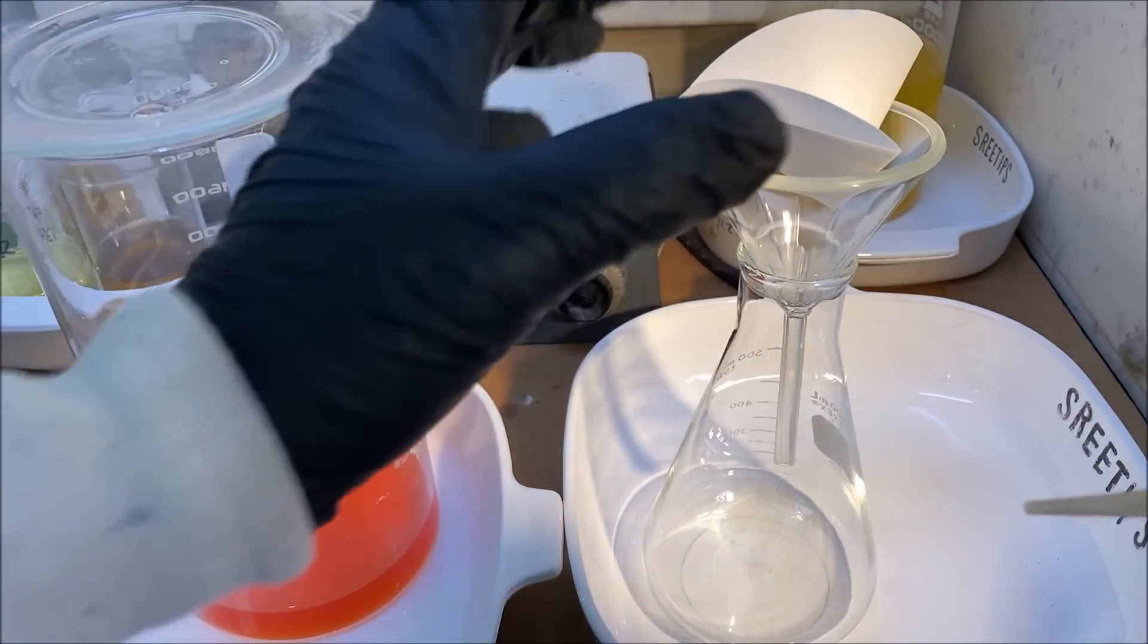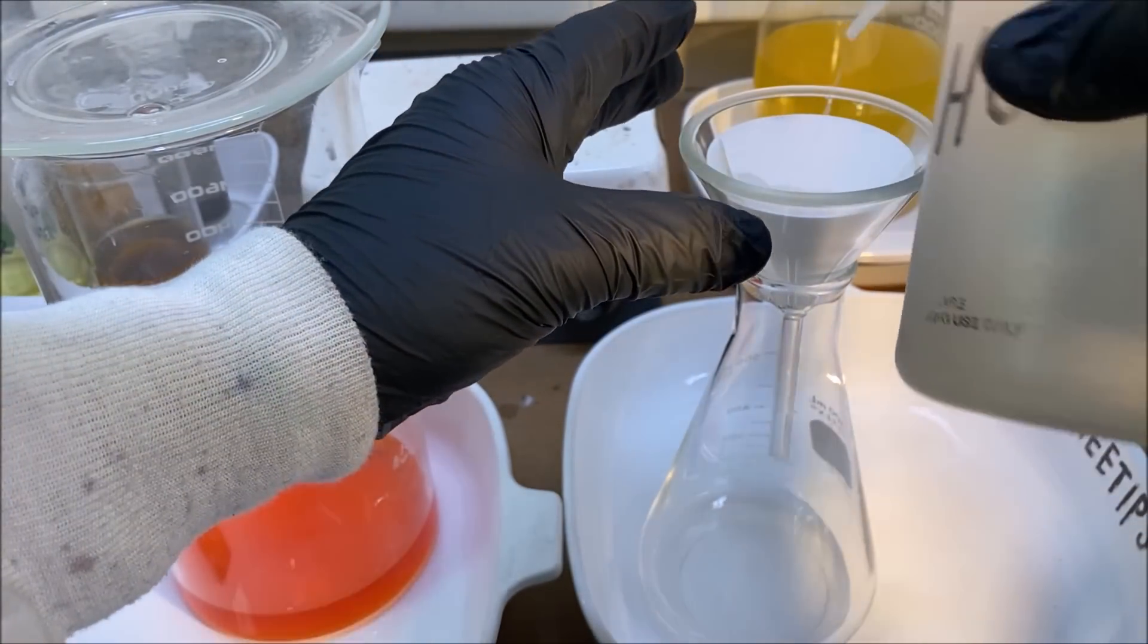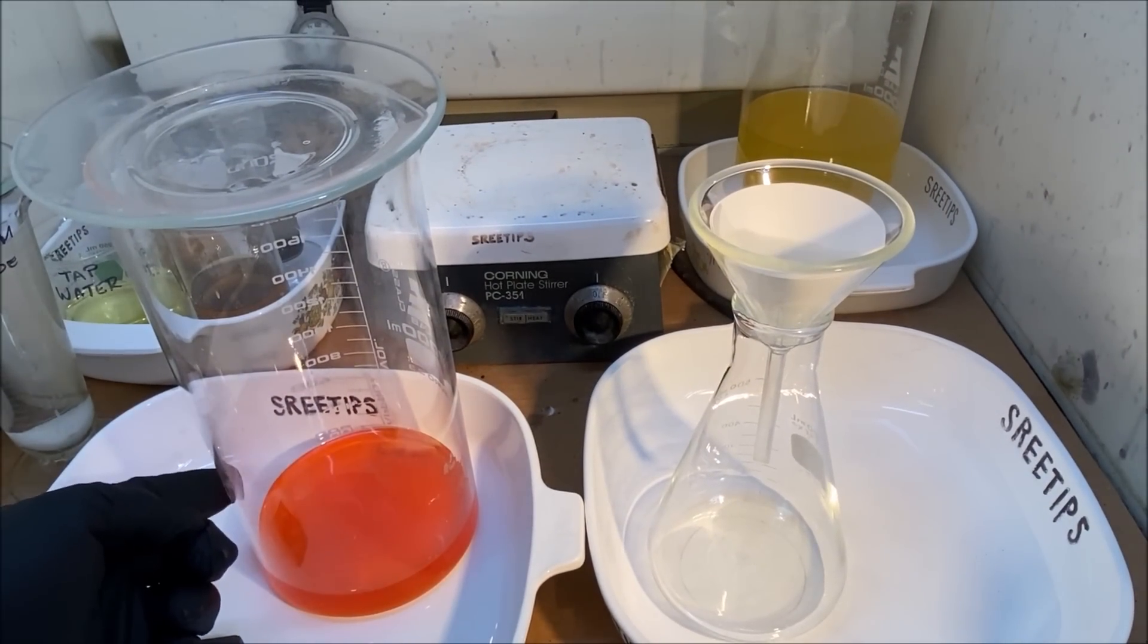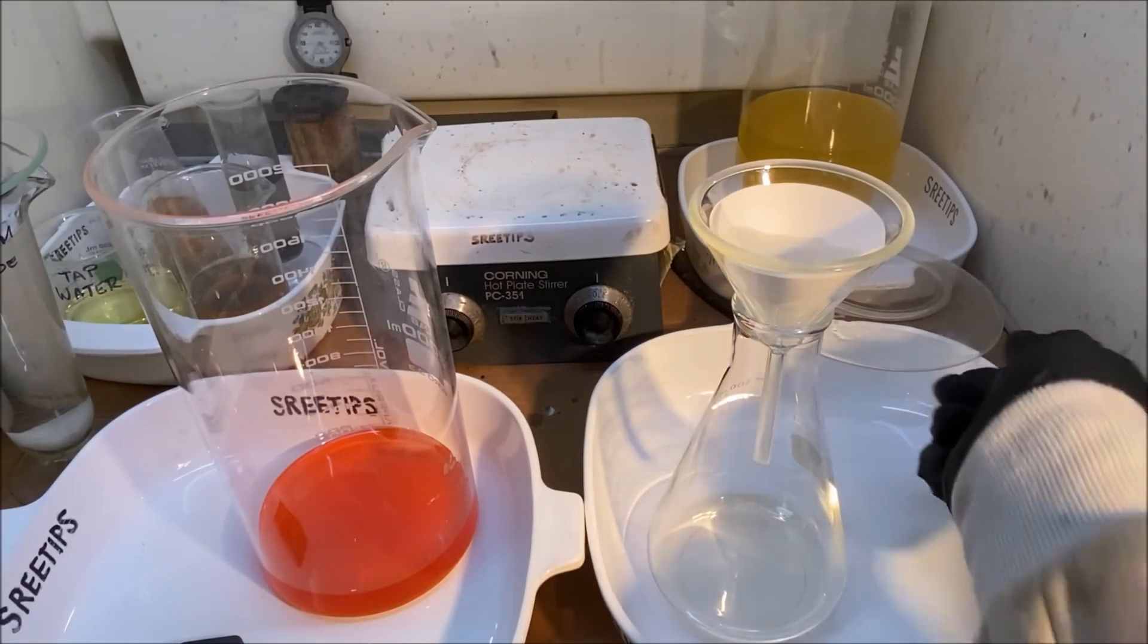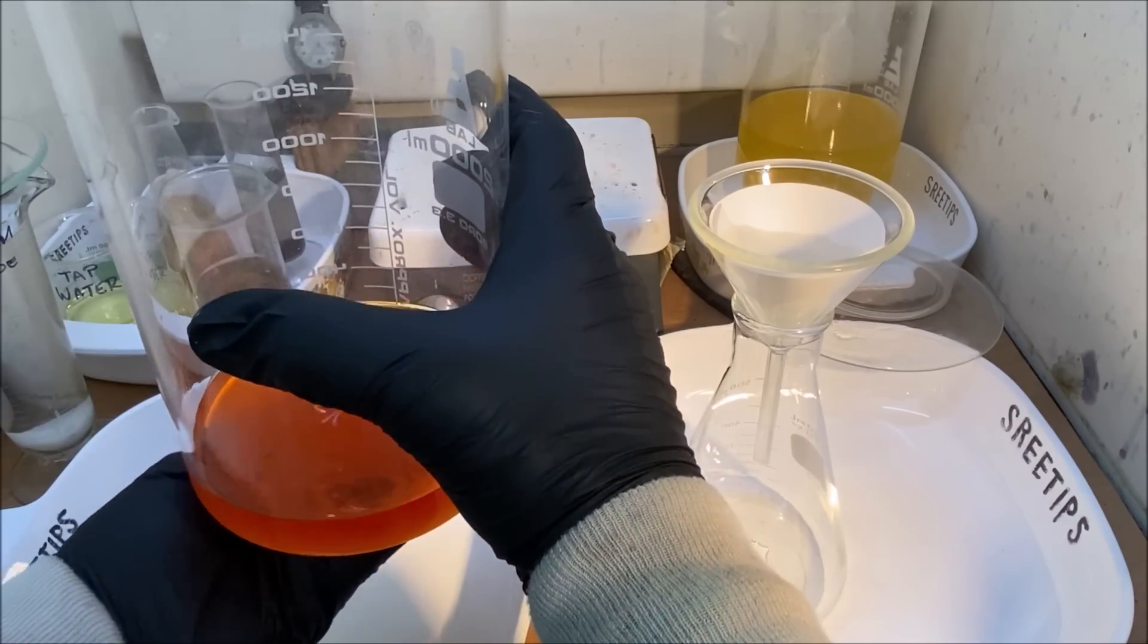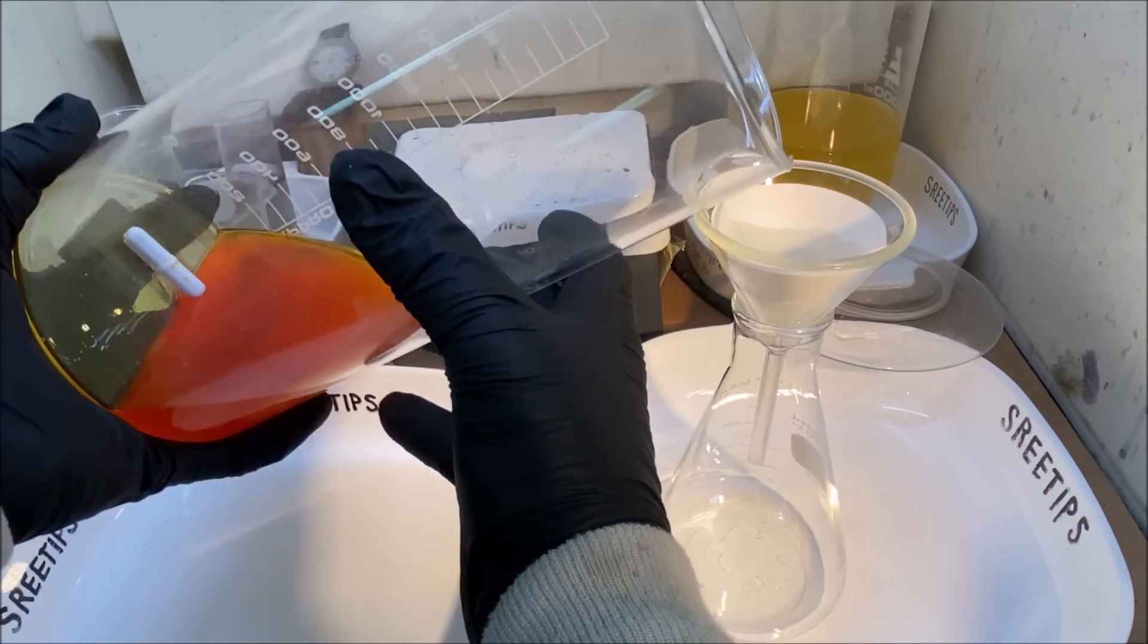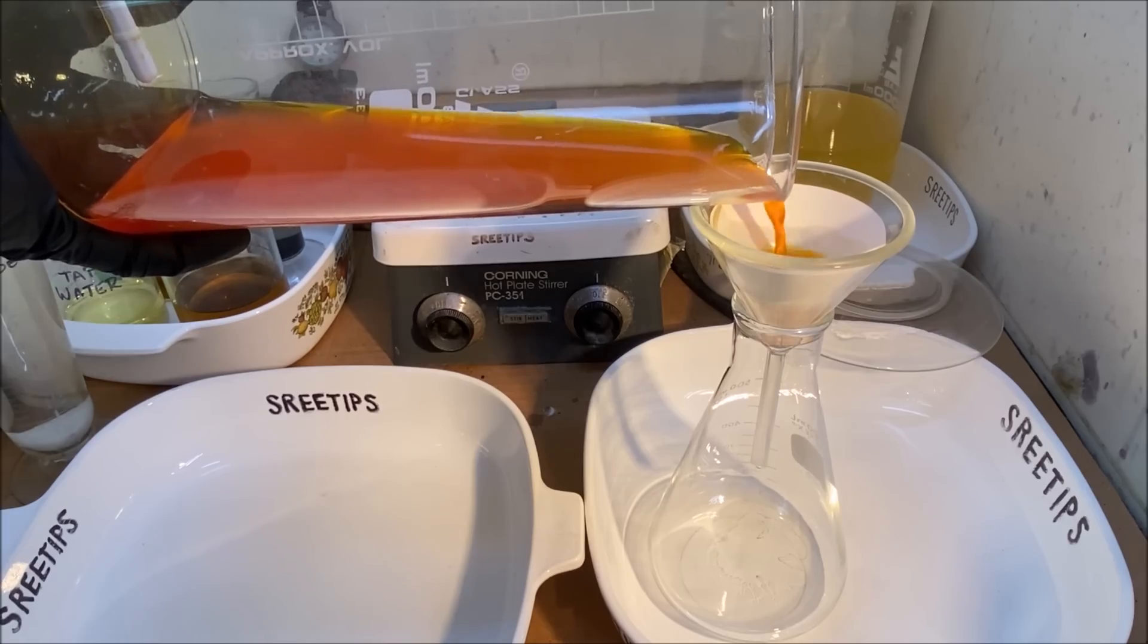What I'm going to try to do is a hot filtration gravity filter. I'm using hydrochloric acid that's the rinse medium here and this liquid in here should be high purity platinum. So we shouldn't need to do anything except filter it and then precipitate it. You can see that's the filter paper down in there. That's all we're doing here is filtering out our filter paper. I'm gonna try this, it's not real hot, not chilled either.